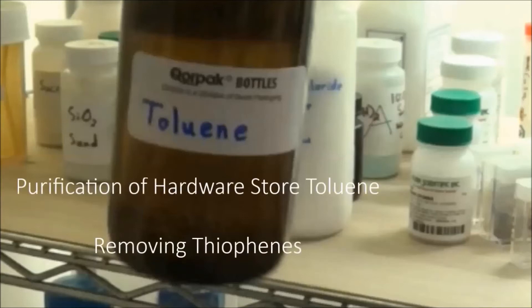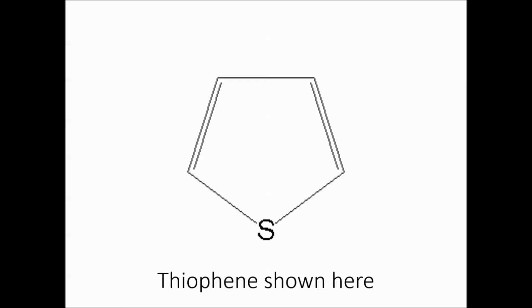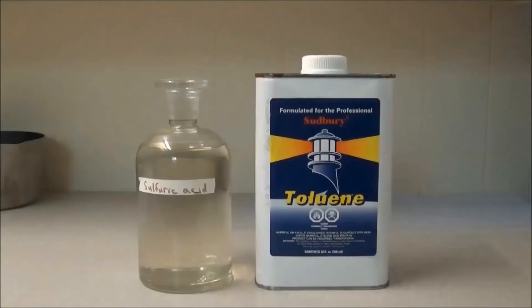Hello everyone, and welcome back to my lab. In this video, I will be purifying hardware store toluene. Most toluene contains some thiophenes, which can't be removed by distillation. I will use sulfuric acid to remove them.